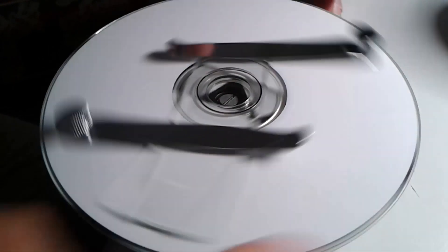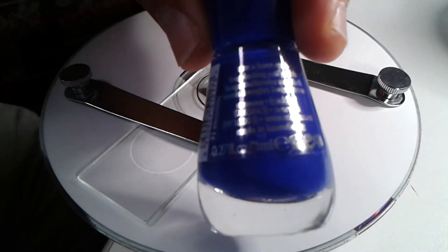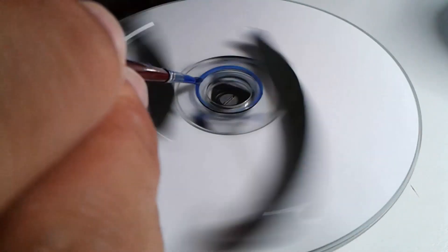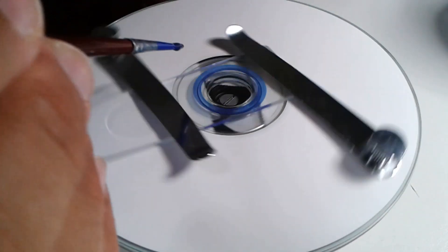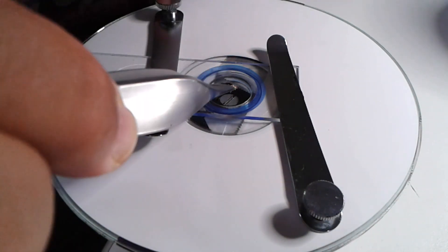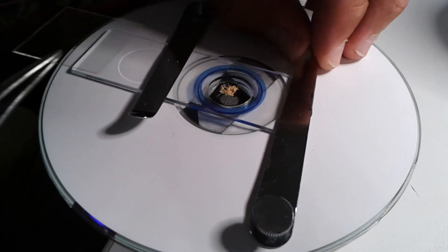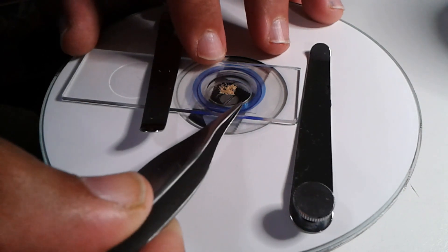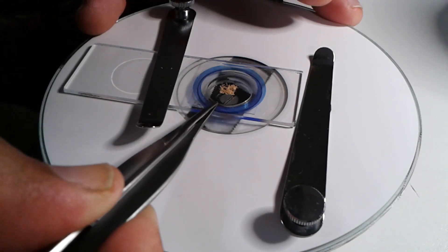I'm using blue nail polish, blue being a favorite color of mine. I diluted the nail polish with quite a bit of acetone and applied a ring of it. Then I applied the pollen into the concave part of the slide and placed the cover glass on top. The nail polish glued the cover glass to the slide.